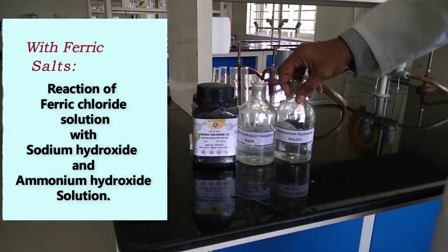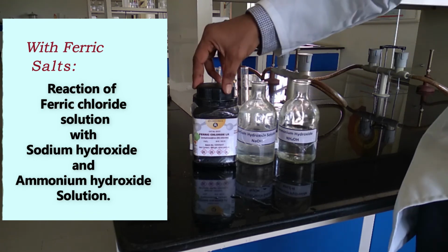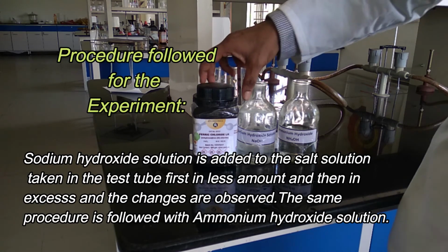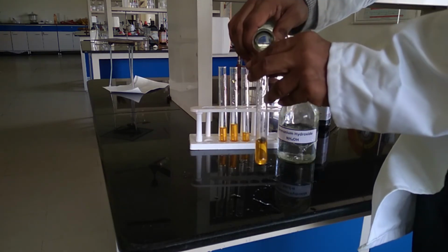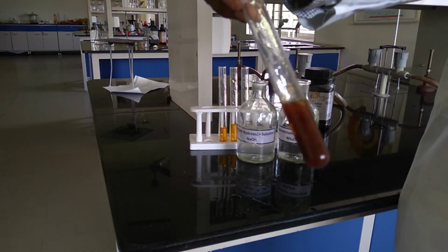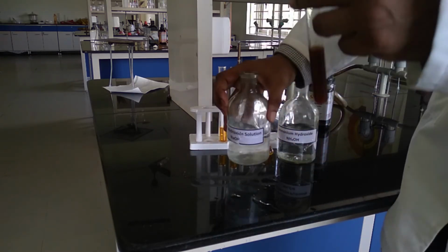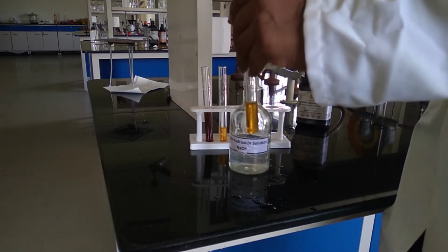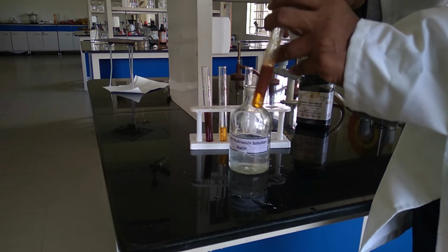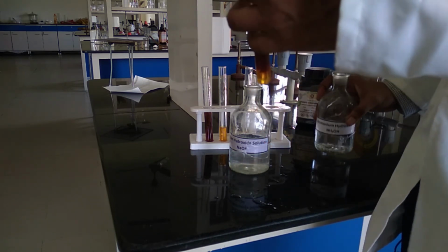We are going to see the effect of sodium hydroxide and ammonium hydroxide on ferric salts. I have taken ferric chloride. When we add sodium hydroxide into it, it forms a dirty brown color precipitate of ferric hydroxide. If we add sodium hydroxide in excess, there is no change. When you add ammonium hydroxide in small amount, it also forms a brown color precipitate of ferric hydroxide. If we add ammonium hydroxide in excess, there is no change.